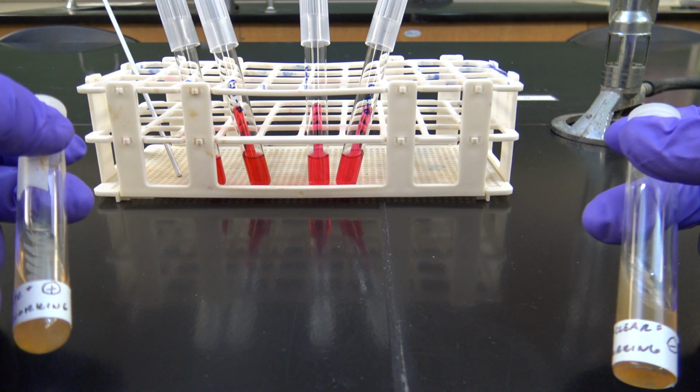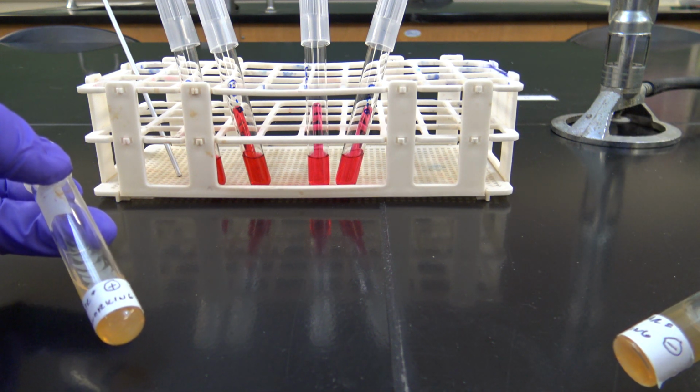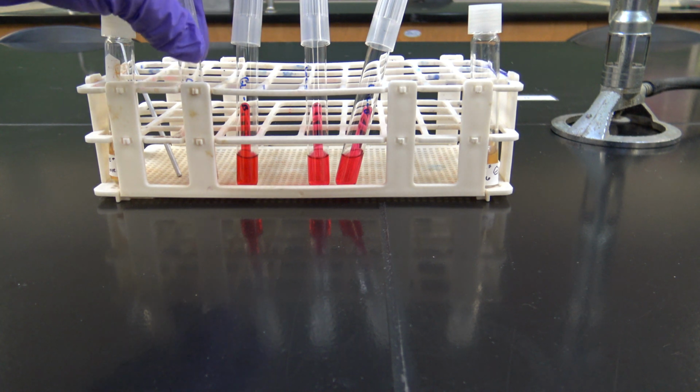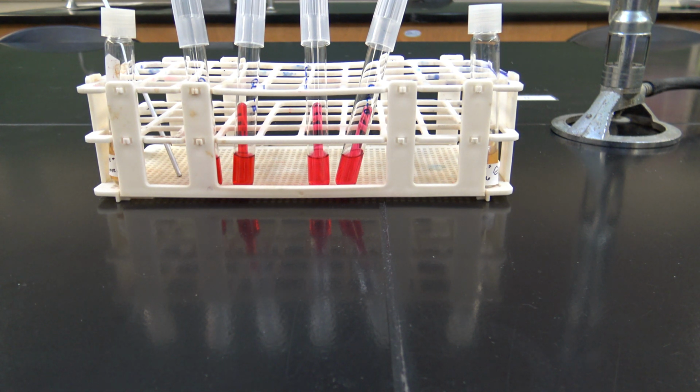And so we want to go further in this project. Now we know we've separated them and we've identified them as gram positive and gram negative, but those are very vast categories as well. So we have to keep going further down the line on identification. So next up is the utilization of carbohydrates, or sugar metabolism, for each of these microbes, and that'll help us further identify what uses what sugar.